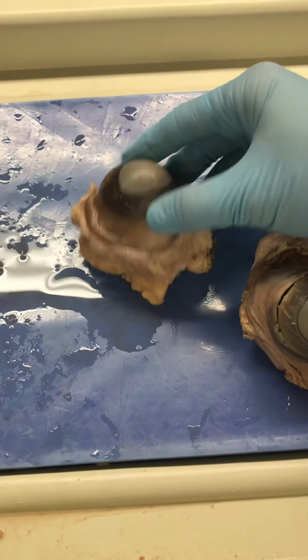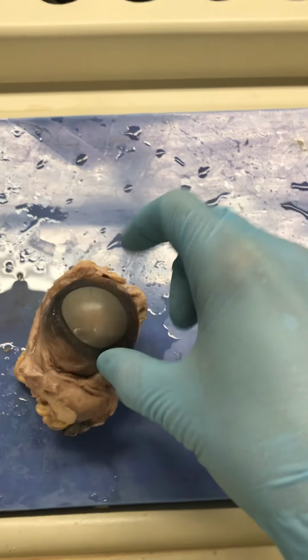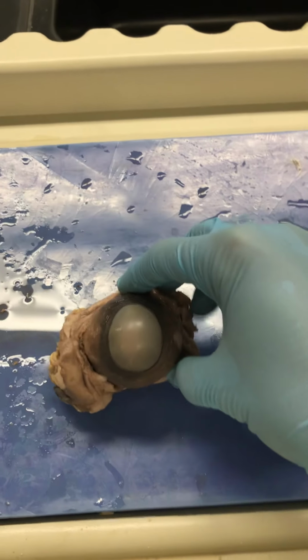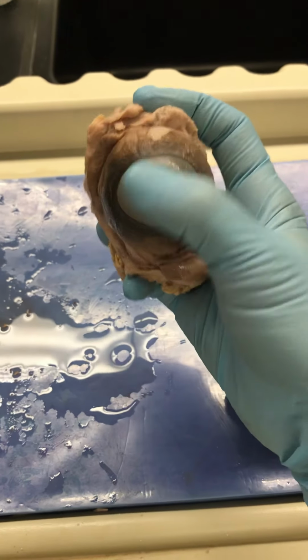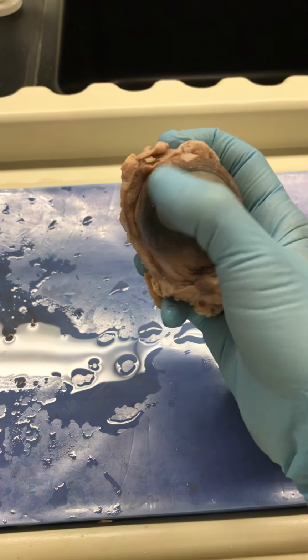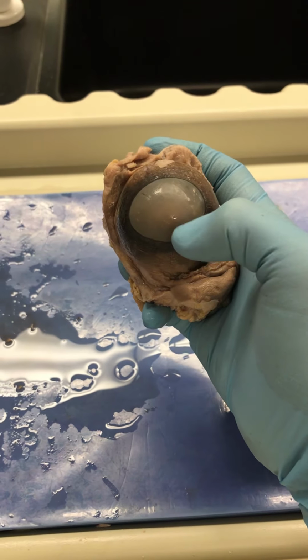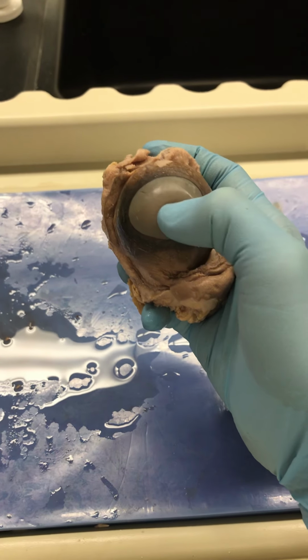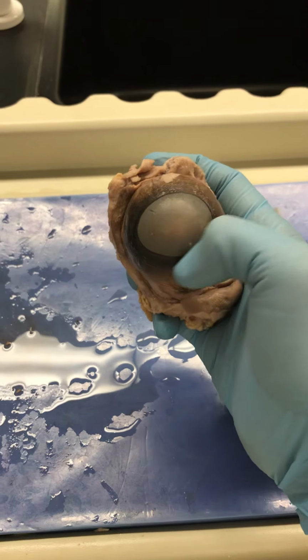Now we can move over to the eyeball. Woo-hoo. I'm just going to go ahead and do these together because this really just takes 5 seconds. So this is the cow eye, and it's looking at you here. So this is your cornea. All right, now it's been glossed over because of the preservatives, so it's cloudy. But you can see the pupil and the lens, that kind of ball looking structure is the lens, and then the iris would be the colored part of the eye.